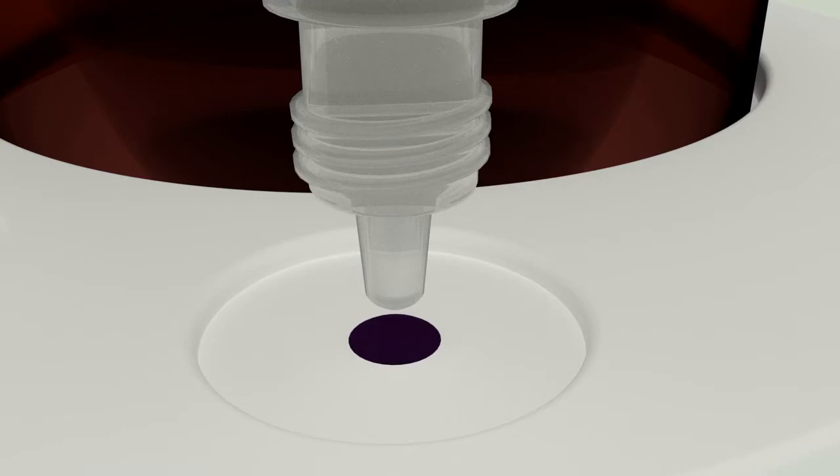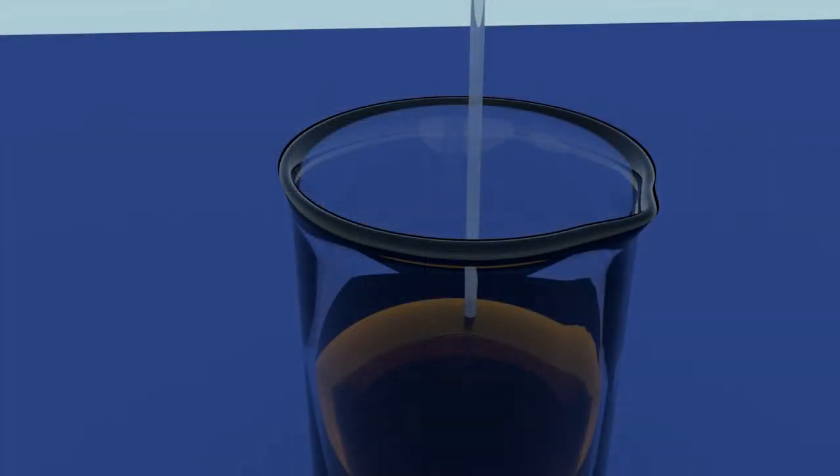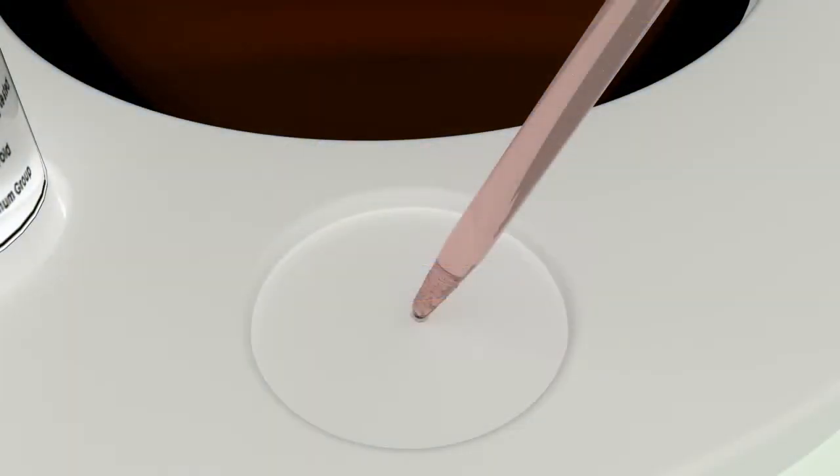To perform this test, you will need to take a sample of your solution. Traditionally a pipette is used for this purpose. However, since you only need one or two drops of solution, you can use an eye dropper or even a glass or plastic stirring rod. Place a drop or two on a clean paper towel, mirror, or as seen here a drop plate.